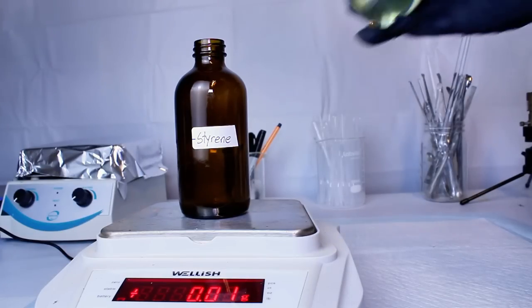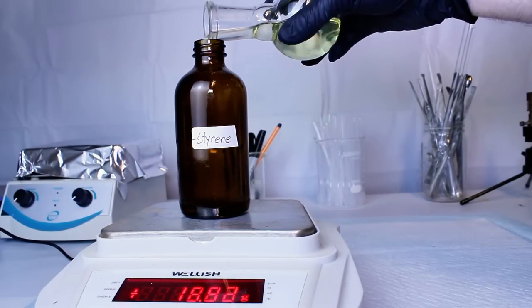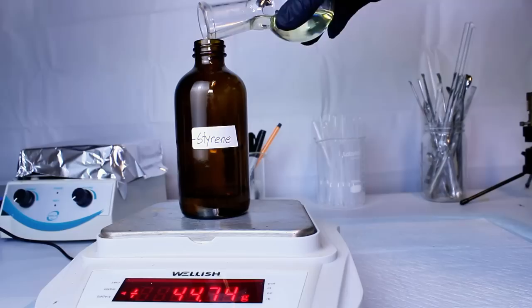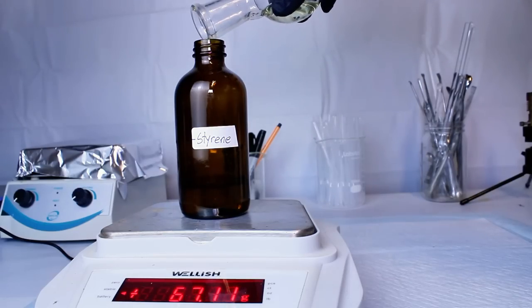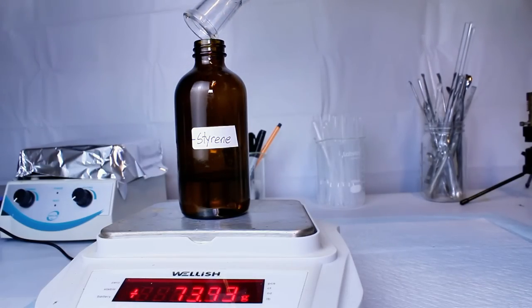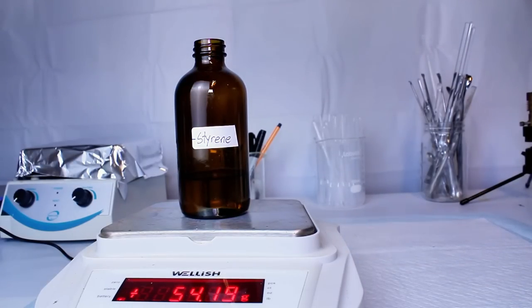This is important because pure styrene can auto-polymerize back into polystyrene, and when it does so, it does it very exothermically, which can be very dangerous. There are inhibitors that can prevent this, but I don't have any and I plan to use this stuff pretty much immediately, so I don't bother.